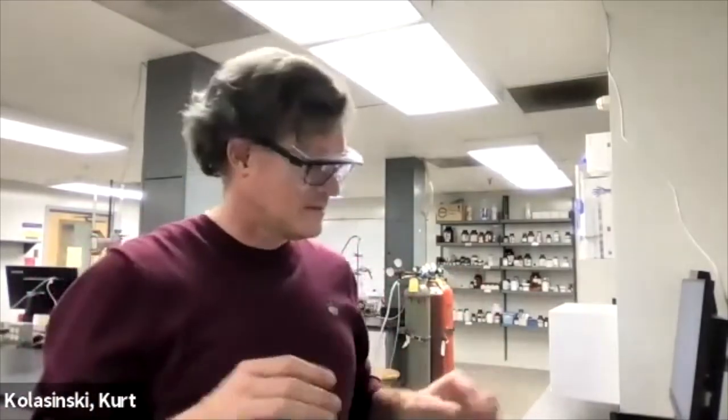And I'm going to take the fluorescence then as a function of iodide concentration. Then we're going to take out those samples, use the one that has no iodide added and measure its fluorescence as a function of temperature. Five degree steps. Remember there's that overshoot problem. So always set it to like half a degree below where you want to go. Let it shoot up to that, then turn it up to the temperature you want. And you won't have to worry about it shooting over. Give it three minutes at each temperature after it's reached temperature to make sure that it's equilibrated.